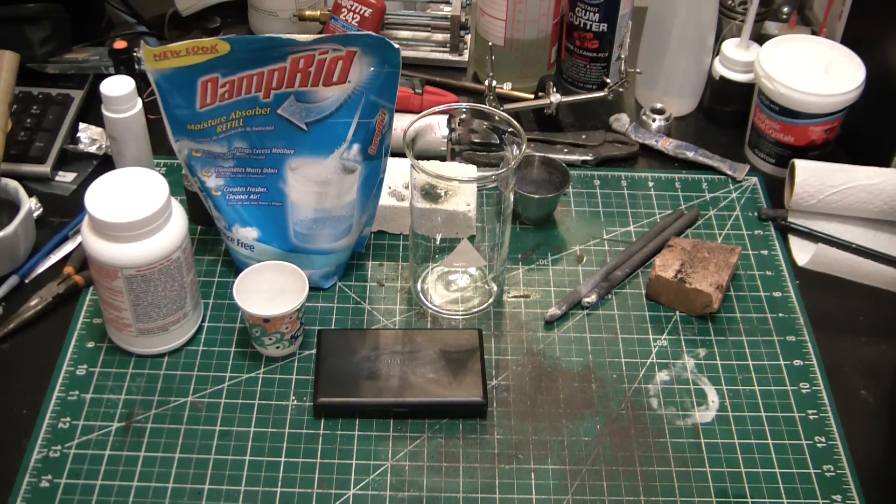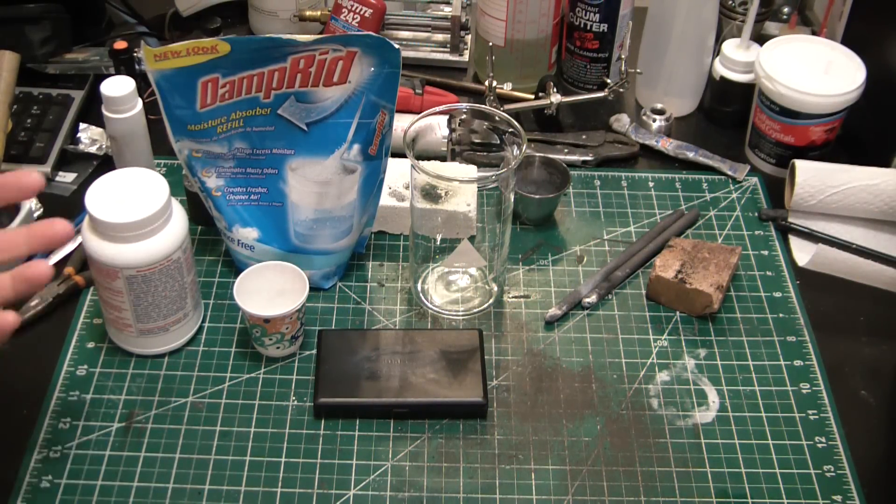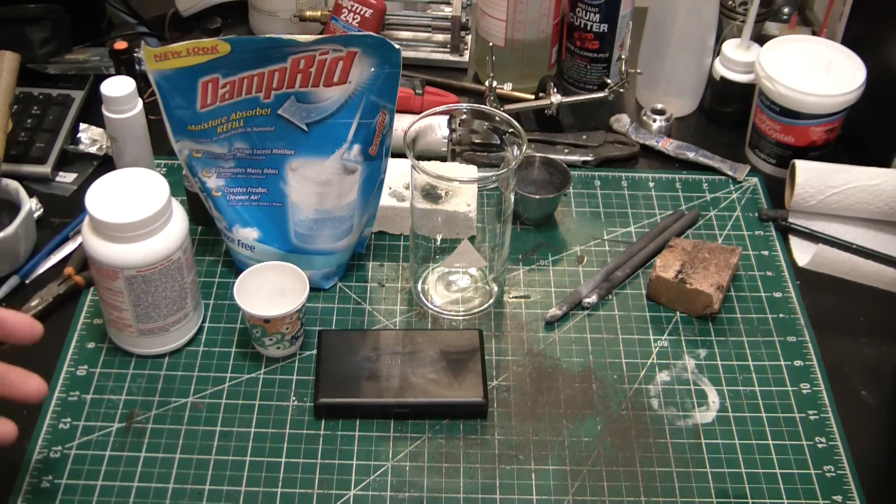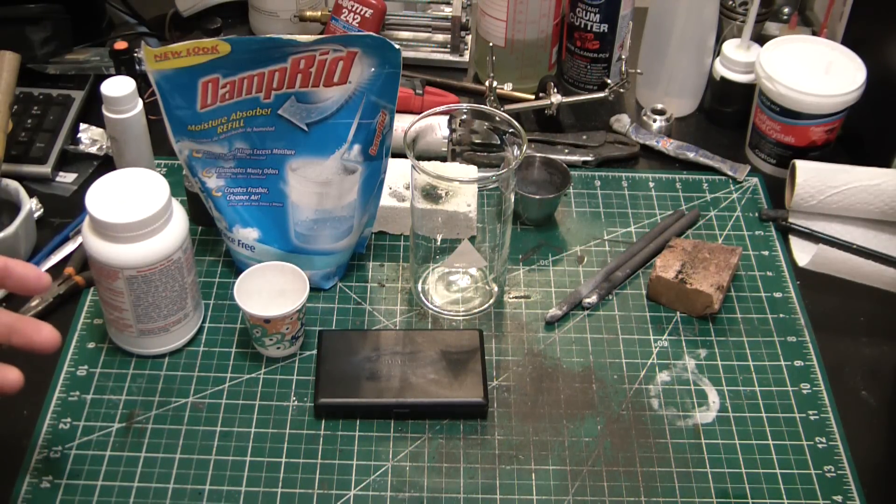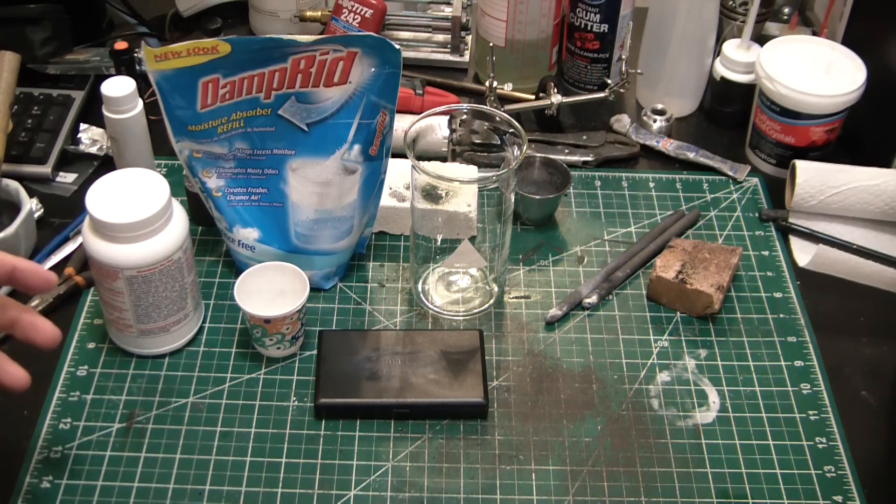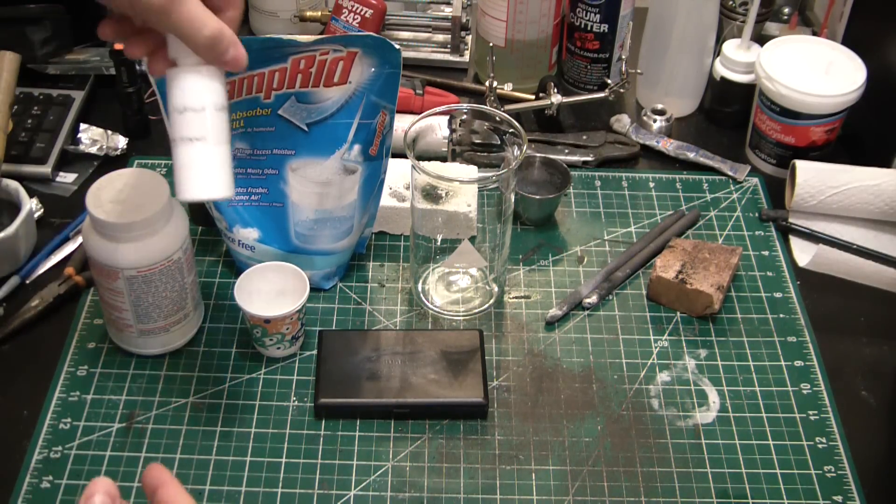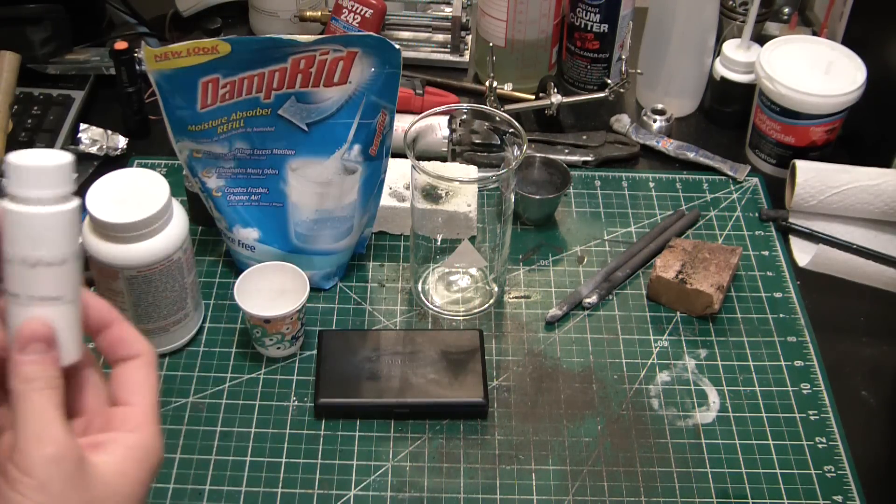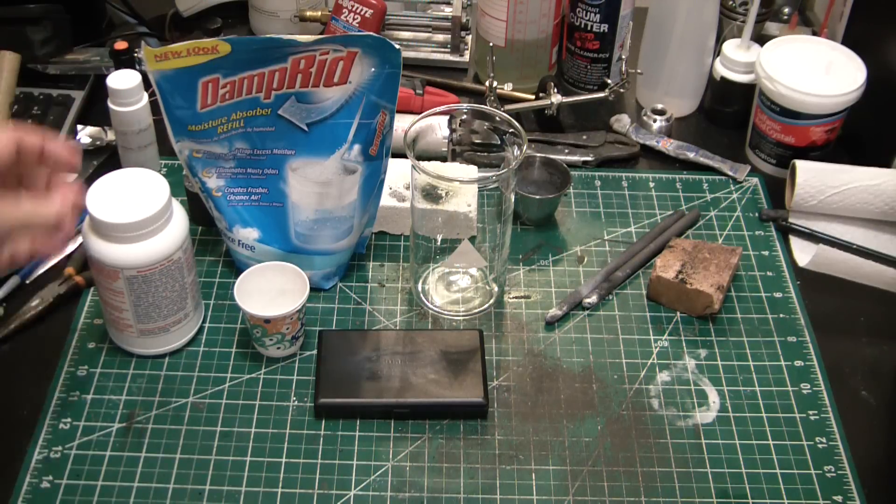Hey, what's going on guys, welcome back to the Elemental Maker. Today we're working on a little side project. I'm working on another pretty cool project that requires calcium hydroxide, which I've pretty much run out of and I'm trying to get this reaction to work.